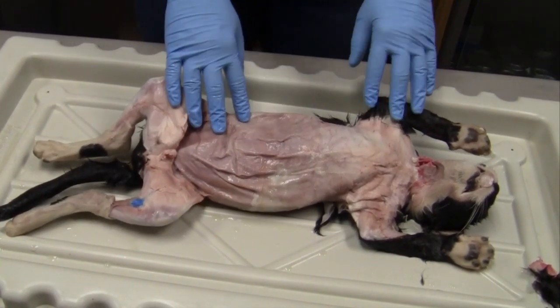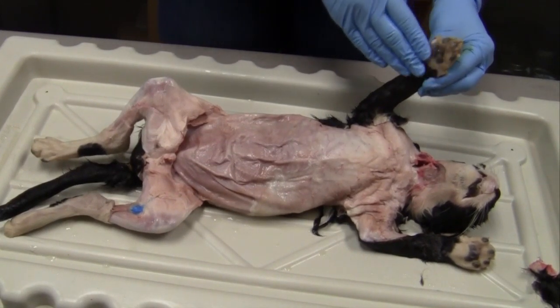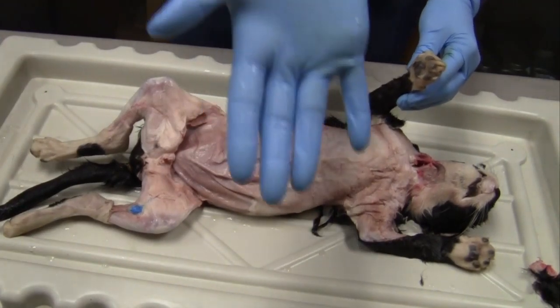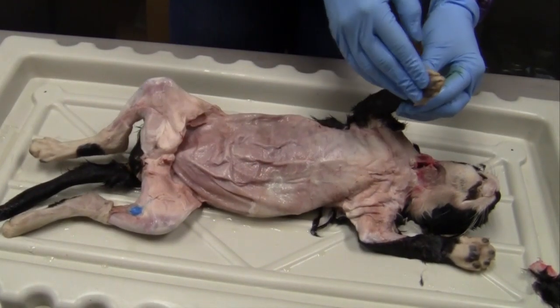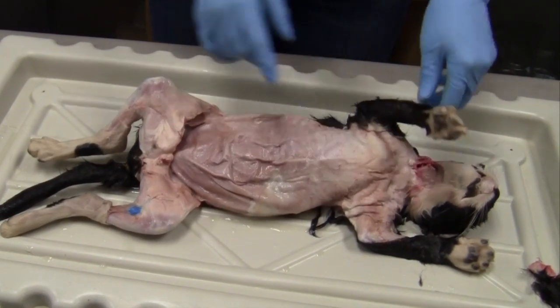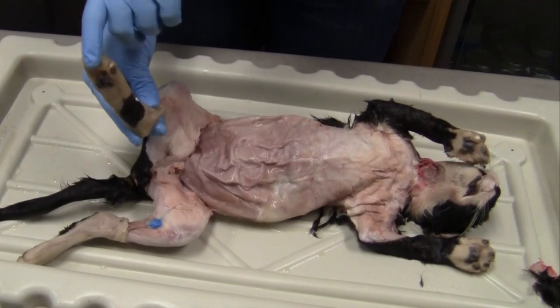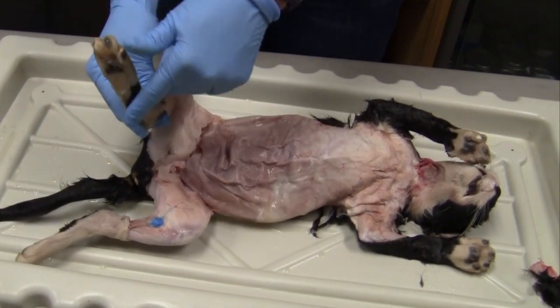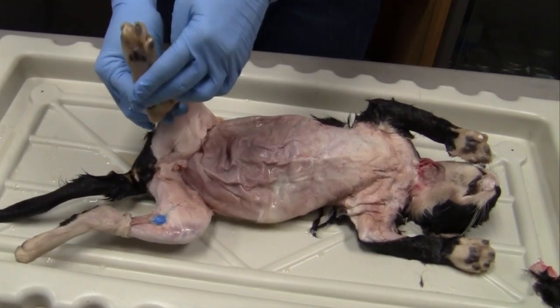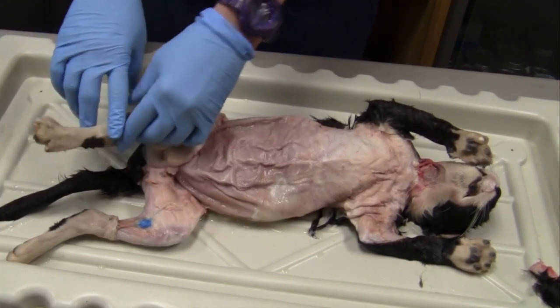And then when we're talking about this part of the cat right here on the foot, we have palmar, just like the palm of your hand. So palmar, and then on the back side, dorsal, once again. And then when we go to the hind foot, we have plantar. Hopefully you haven't ever had a plantar wart, but they're usually on the bottom of your feet. So plantar, and then dorsal once again on the back side of that.